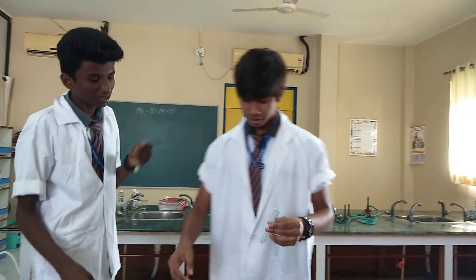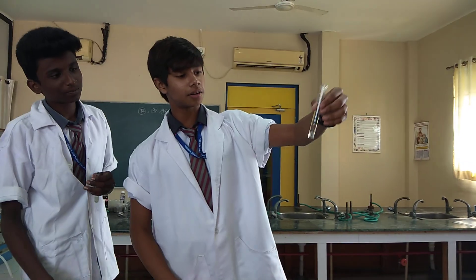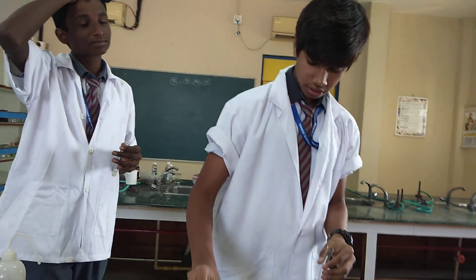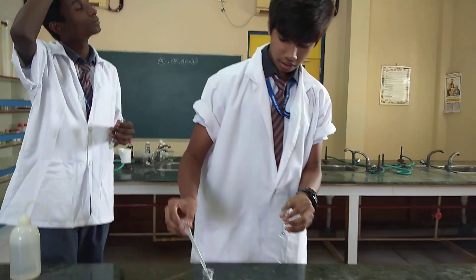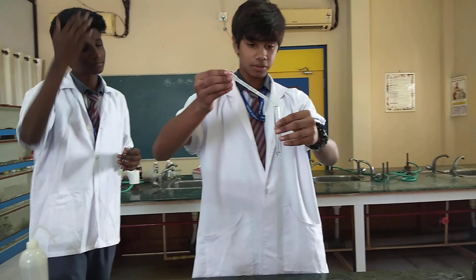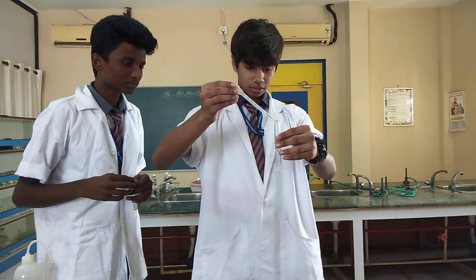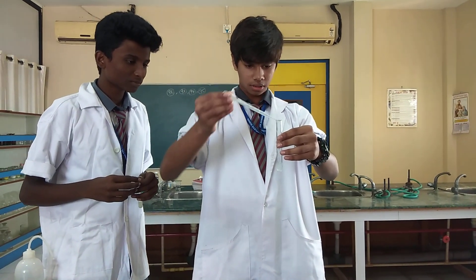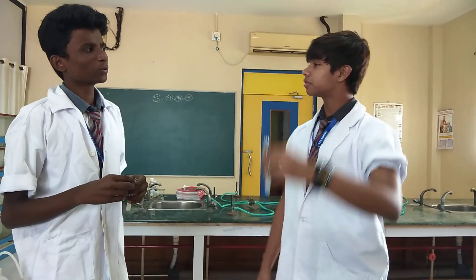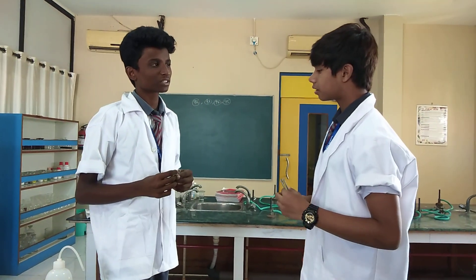I'm having an aluminium sulphate solution. I'm adding a few drops now. I'm getting a white precipitate too. Why don't we add excess NaOH to both of them?